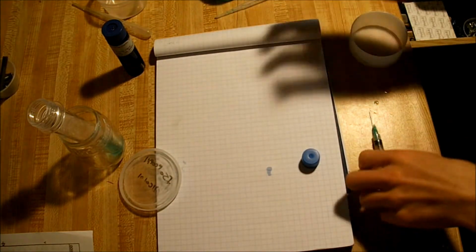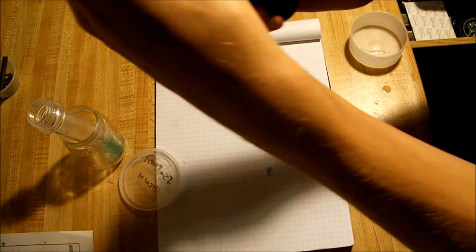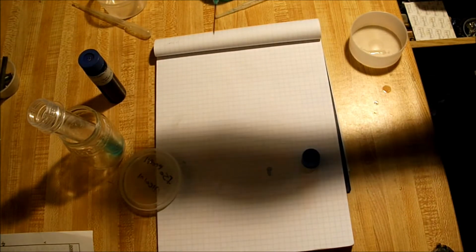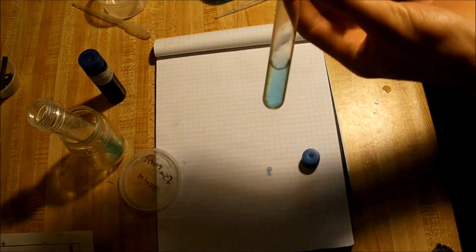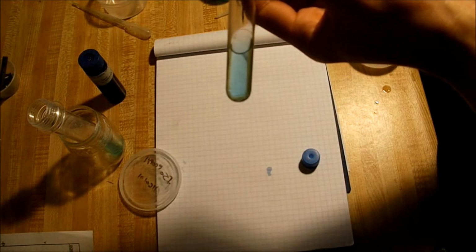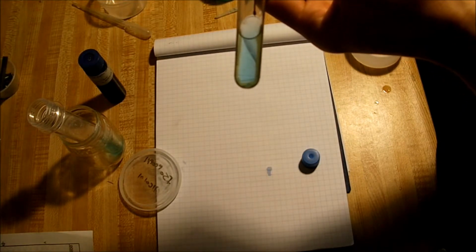You can set that aside, and next you pull a very small amount, maybe 1/10 of a milliliter of TACS into your collection vial, whether that be a pipette or a needle. With a needle, the next step is a little tricky because you're only supposed to add 1 drop. With a needle, it's easy to overdo. So next, you put in 1 drop at a time of TACS.